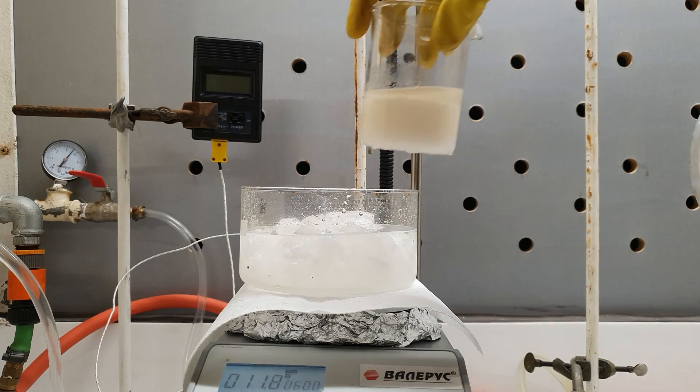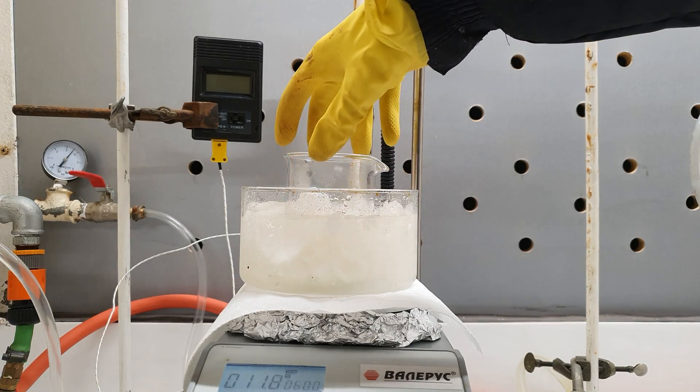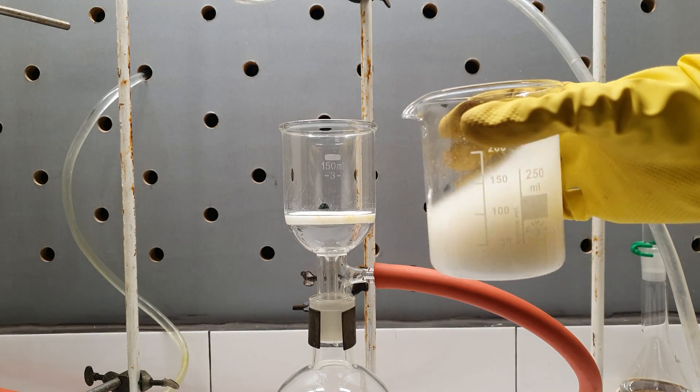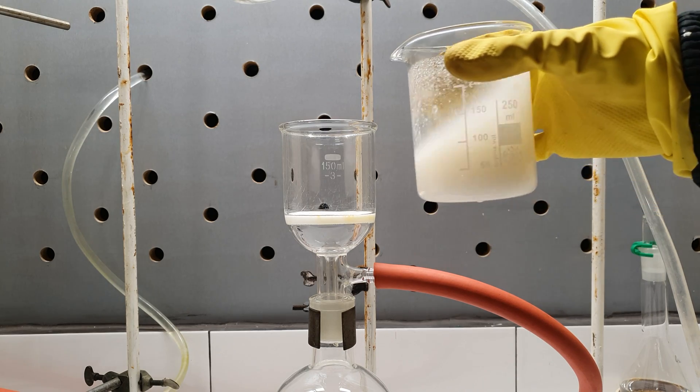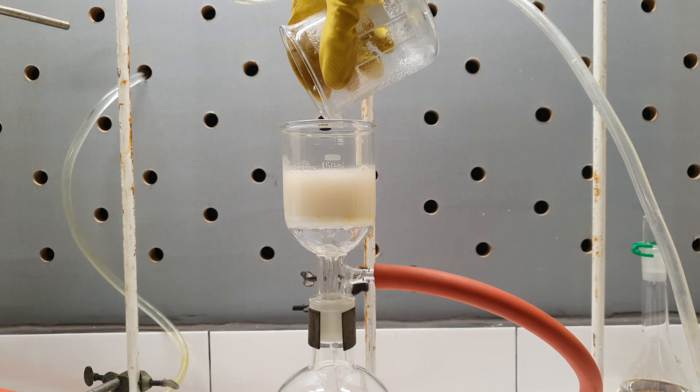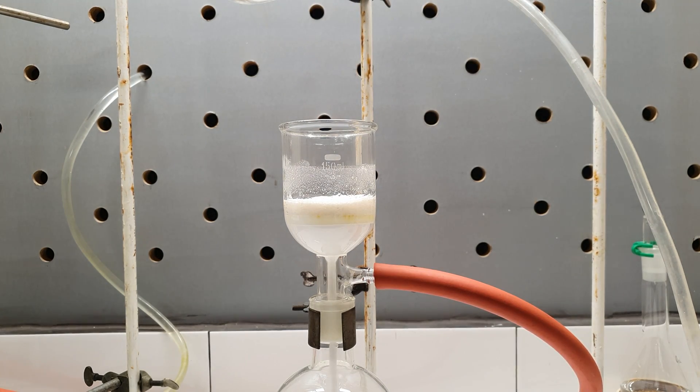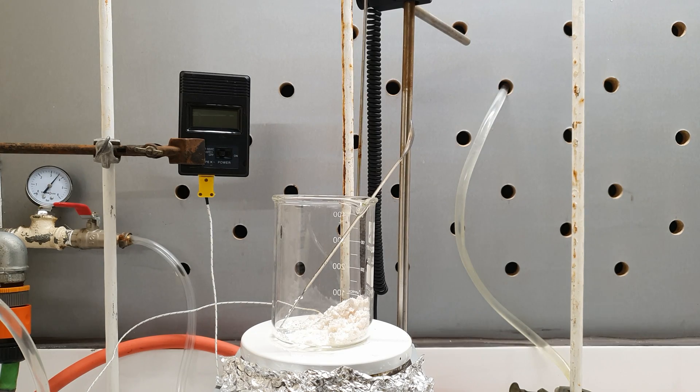I finished the cooling with an ice bath to maximize my yield. Now as you can see I had a beaker full of aspirin waiting to be filtered. I dumped it all on my buchner funnel and washed the beaker with some distilled water. Here is my crude product.